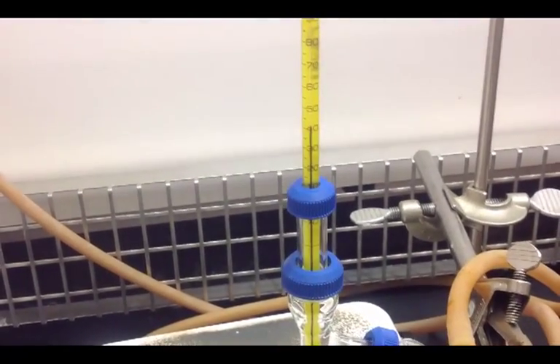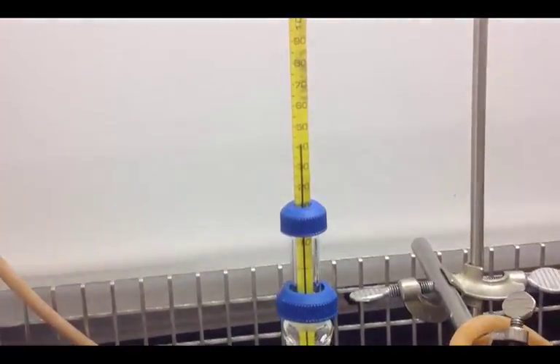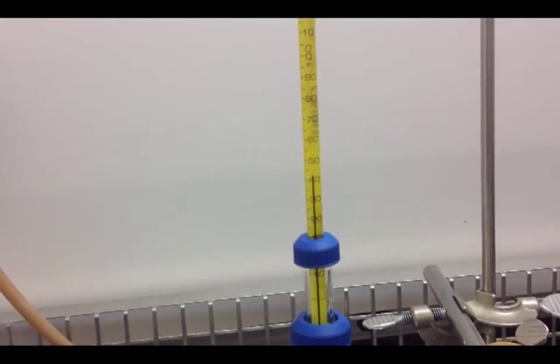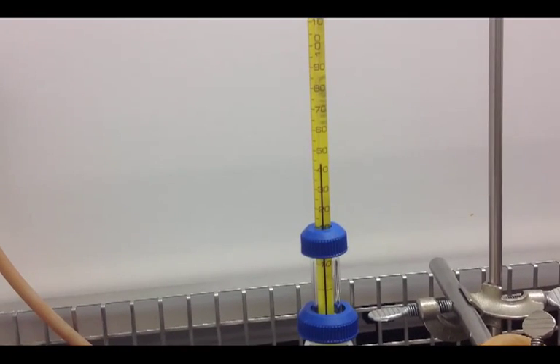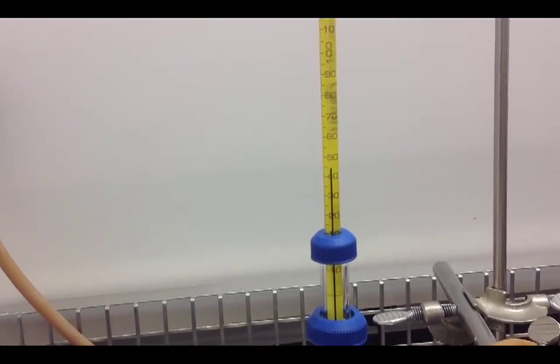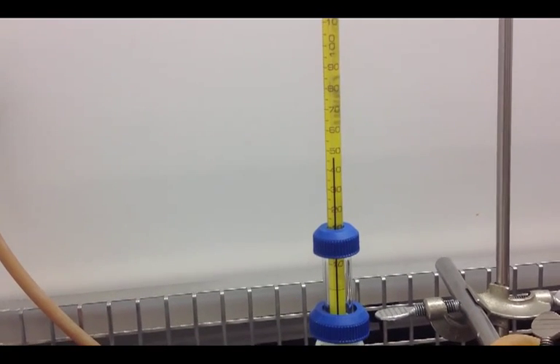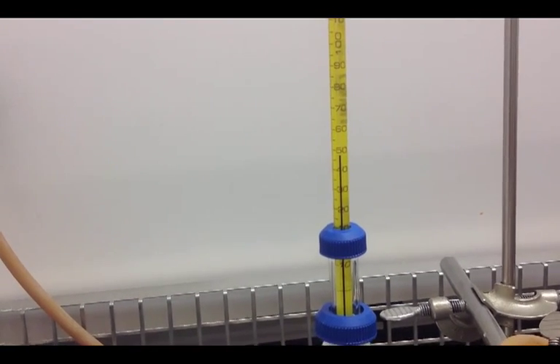All right and as you can see here our thermometer is reading roughly 40 degrees, a little bit above. And that is telling us that we are not quite at the boiling point for either one of our compounds. Once it reaches about 65 to 70, we should start seeing some vapors come off and start a distillation.